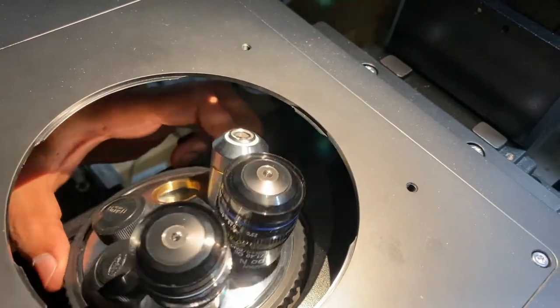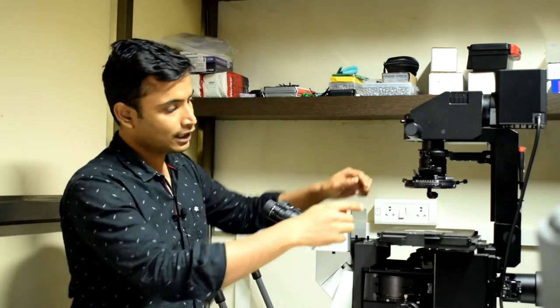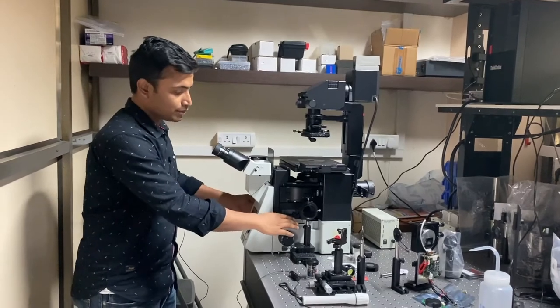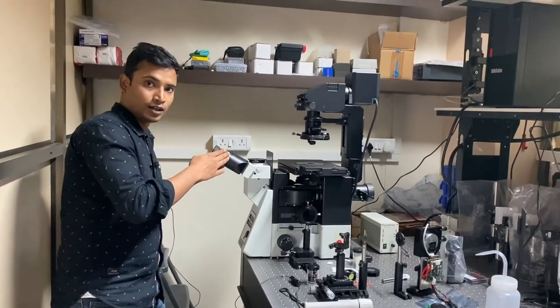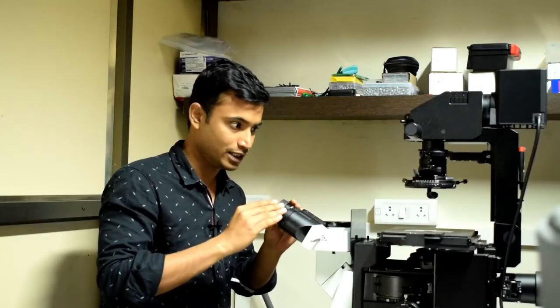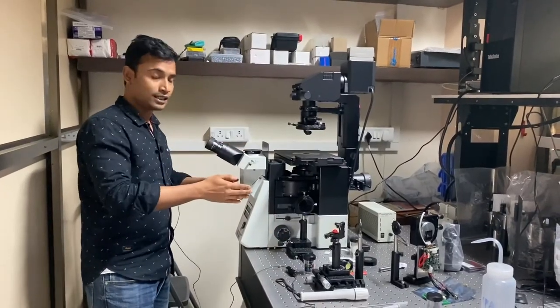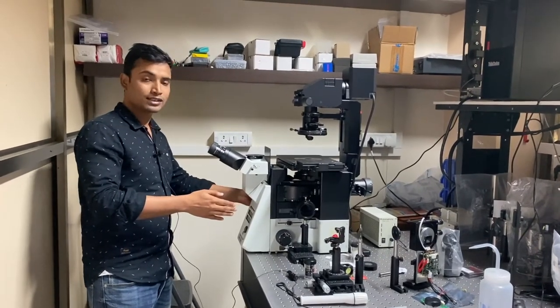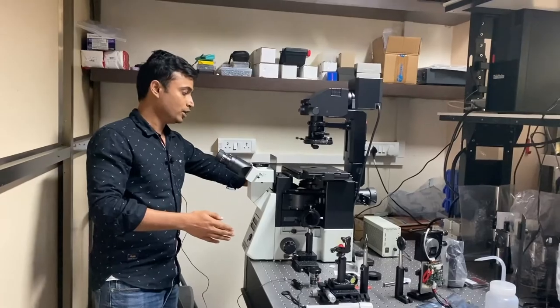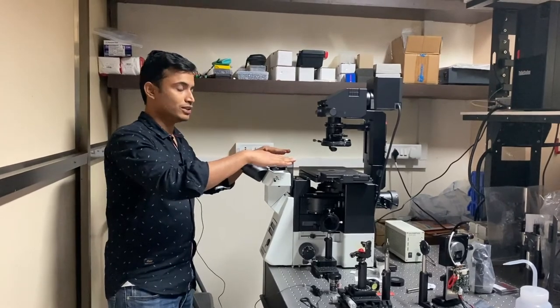In the objective turret, several objectives can be mounted so that we can image the sample at different magnifications and resolutions. Light then travels through a beam splitter — part goes to the eyepiece where we observe the specimen and focus using the focus knob, and part is directed to a camera port where we capture images of the sample.